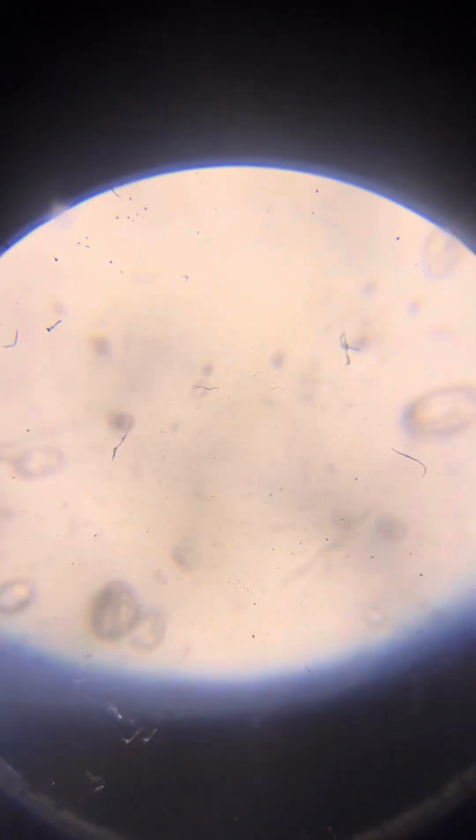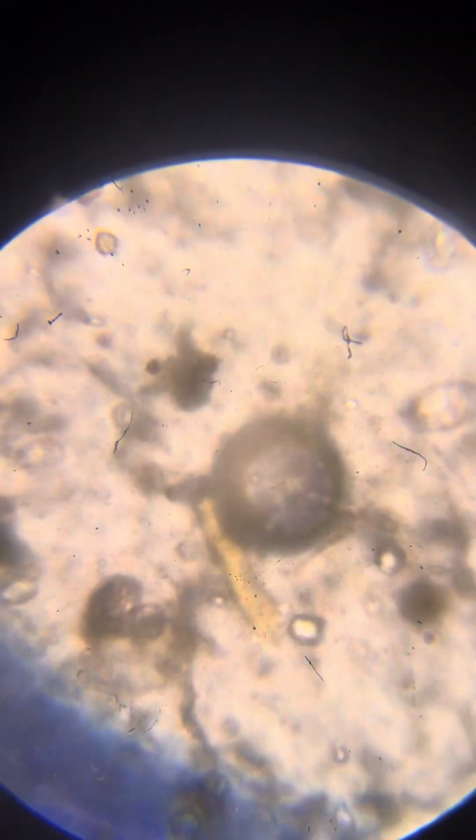Like these ones are fat. I don't know what the functional difference is between fat and thin ones, and I don't even know what the functional difference is between big and small ones. Most probably, bigger ones do bigger stuff and smaller ones do smaller stuff, but I cannot formulate it more than this obvious assumption.